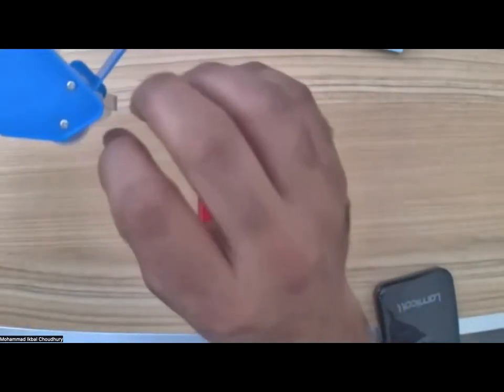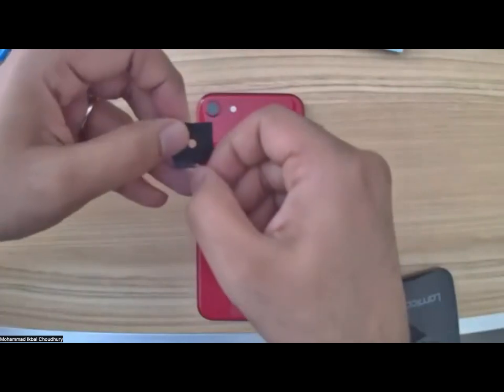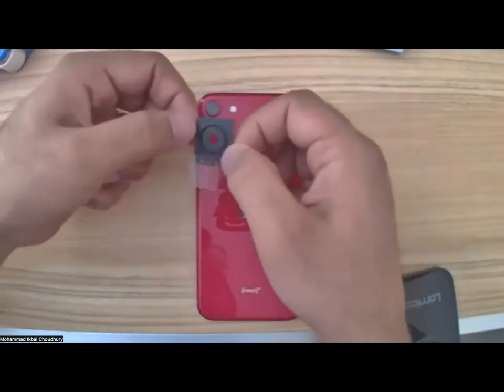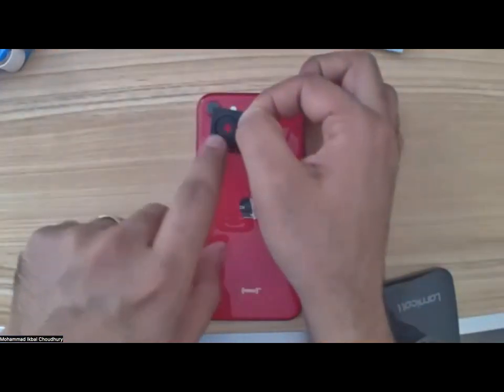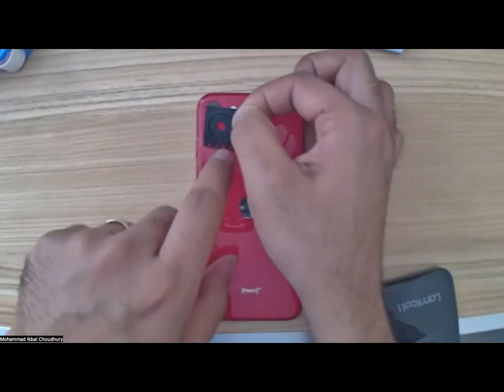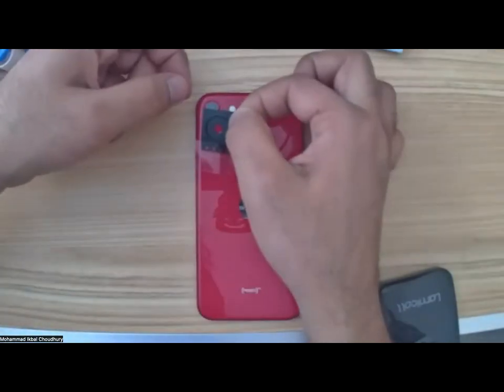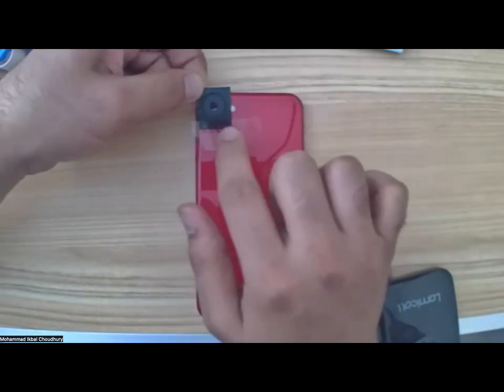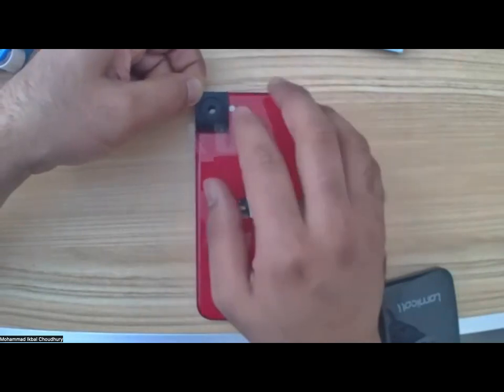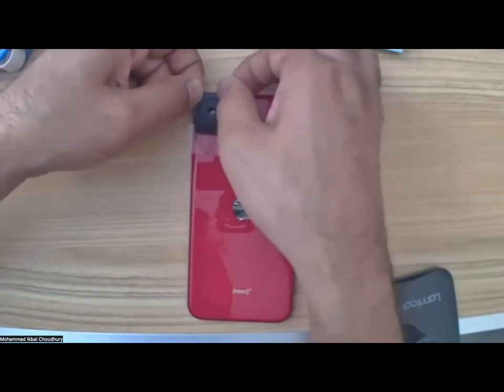So I'll take a small piece of tape and I will first connect it like that. Try to see if you can avoid the groove area while taping it, because the groove is going to fit in snugly with the other side on the microscope. I try to avoid taping the groove area, but even if you do, it's going to be fine. It's a strong magnet, so it will fit in. And taping your phone is not going to damage your phone, so don't worry about it.